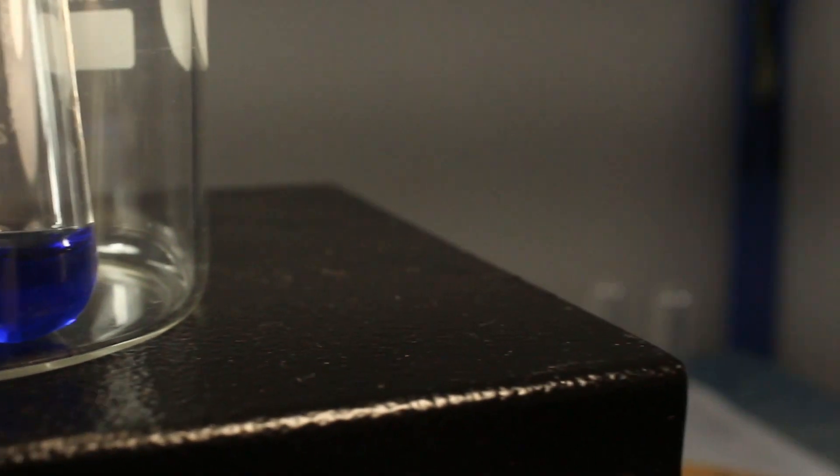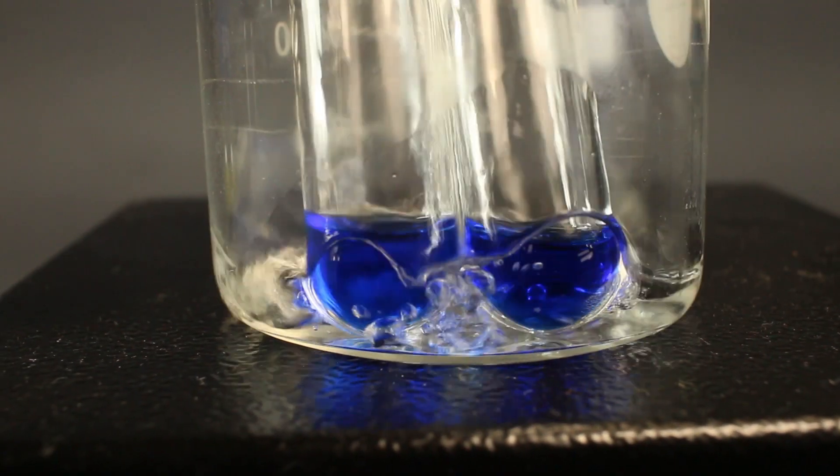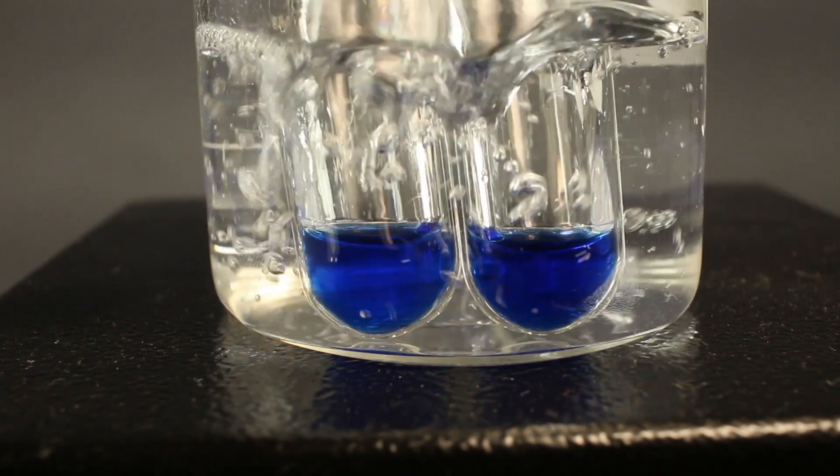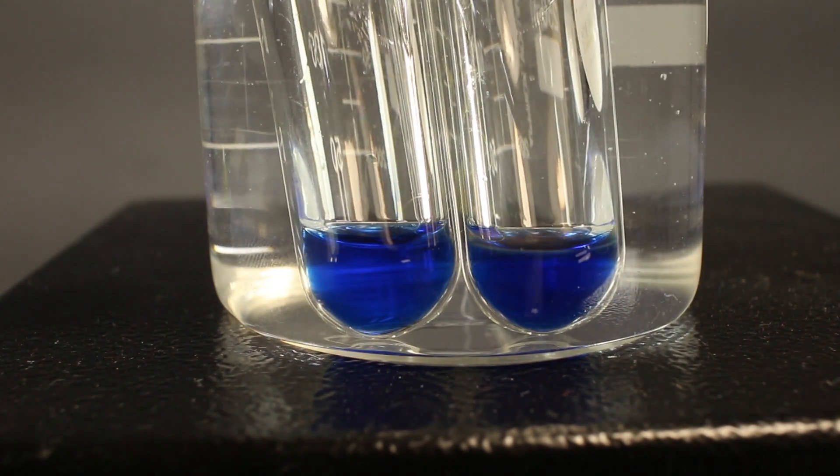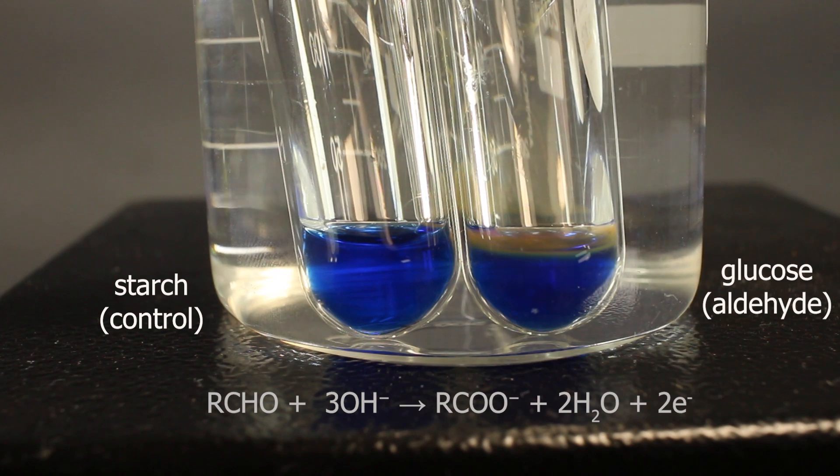Now, we are ready to start, and for that we need to increase temperature, and water bath is the easiest way. Hot water is added, and reaction starts immediately. You see the change on the right, and there is no change on the left. What is going on?